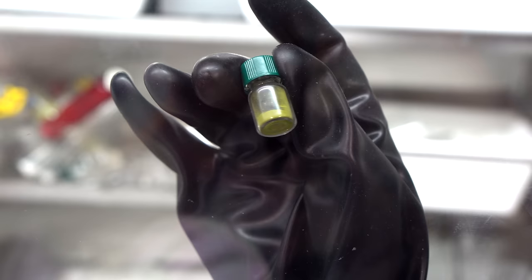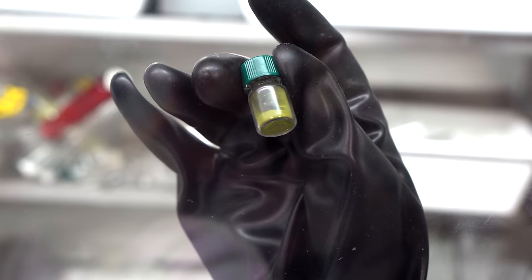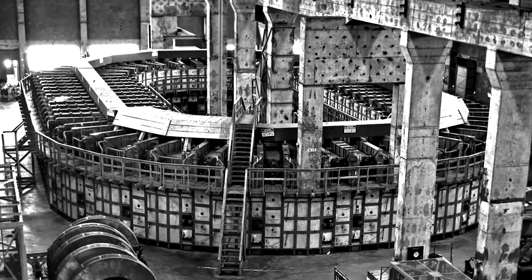It is also worth noting, when tetrachloride is used instead of uranium tetraiodide, the color will also change drastically, from orange to green.